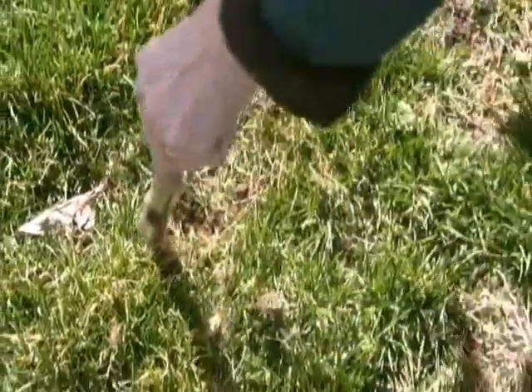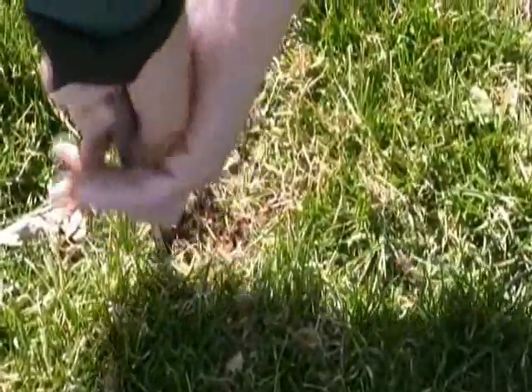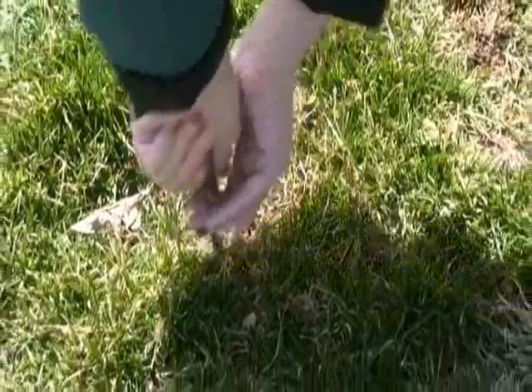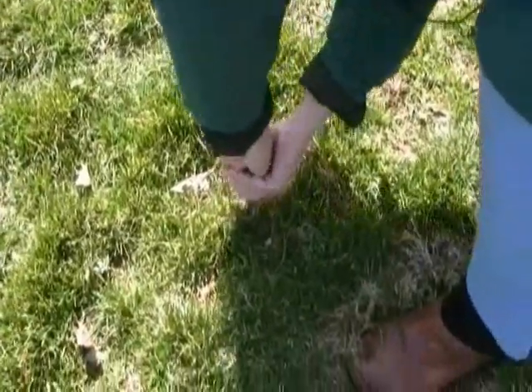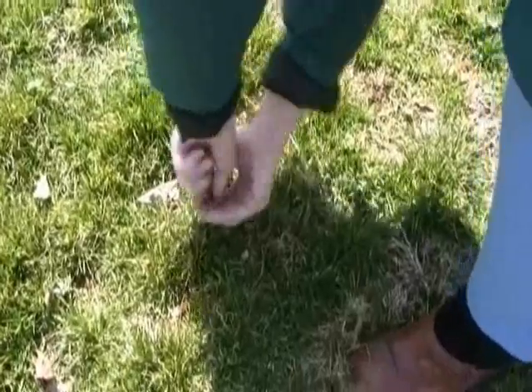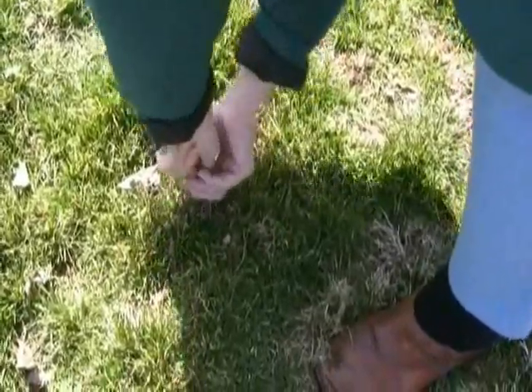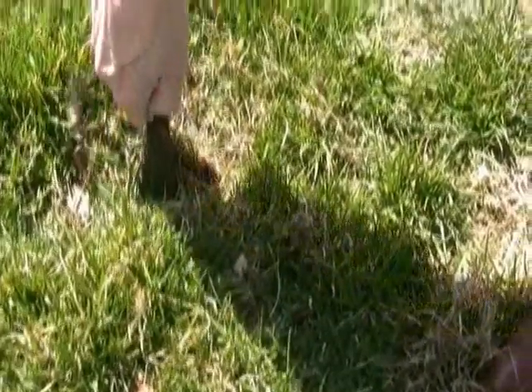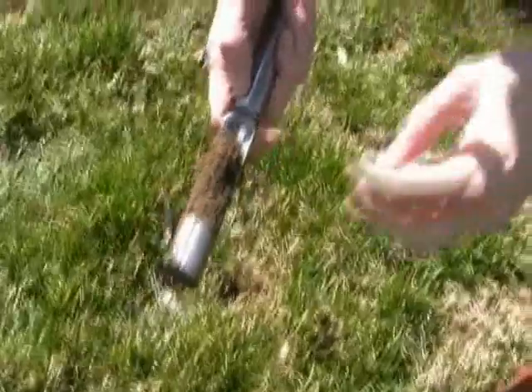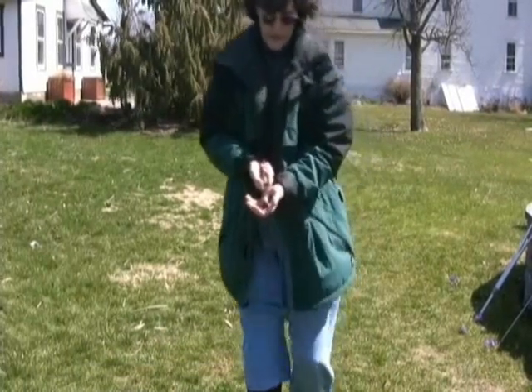So let's go over here where we've got nice grass. We're just going to start pushing that into the soil and turning. We cut the roots of our grasses, pushing down all the time — and remember we've got some fair amount of compaction here, around 200 psi — so that can take a little bit of effort. Just keep spinning it, cutting those roots, getting through any rocks, until your apple core is flush with the surface at about three inches, and then you just pull the core right on up. There's your core with the organisms down to that three-inch depth.